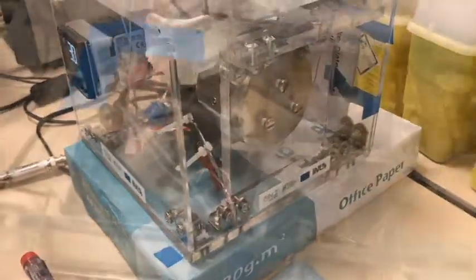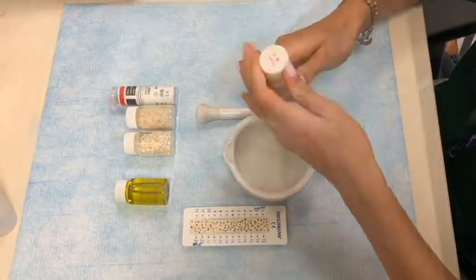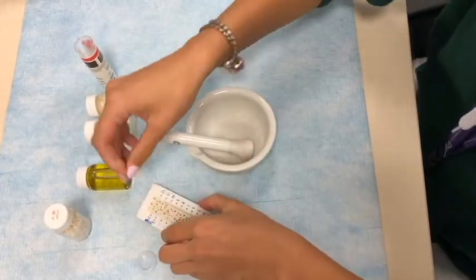Firstly, 2 grains of rice are collected in order to grind them. After grinding, we place it into a capillary tube. As you can see, it is important to put plasticine on both sides of the capillary tube.